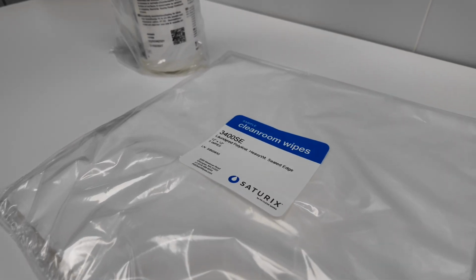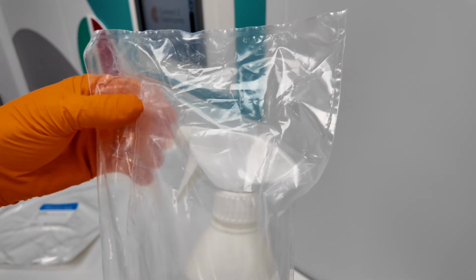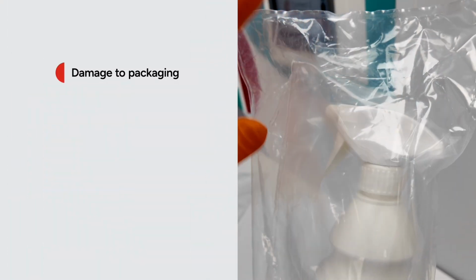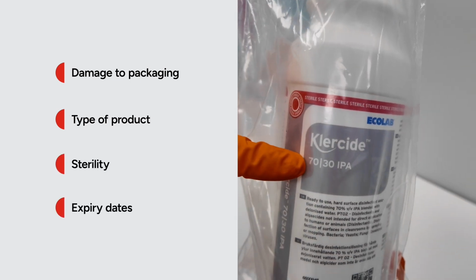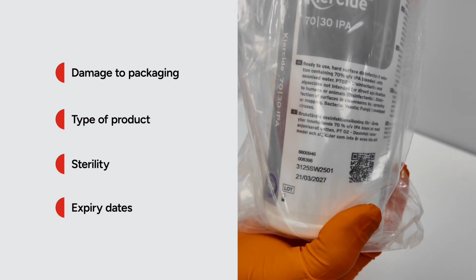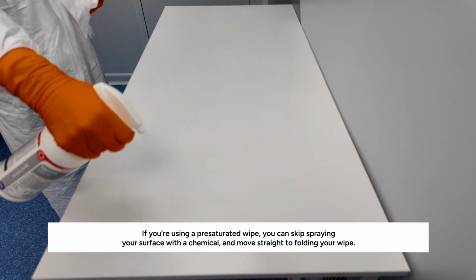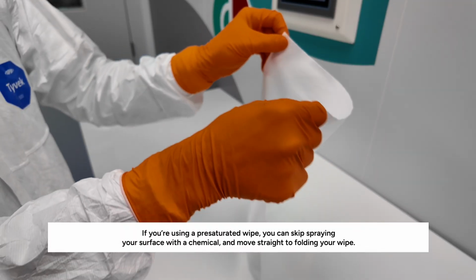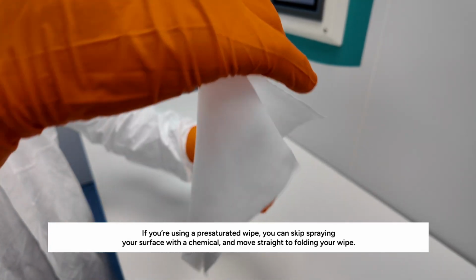When looking to correctly clean your cleanroom surfaces, firstly review the cleaning products to ensure they're fit for purpose. Key areas to check include ensuring the packaging is free from damage, the sterility of the product, the type of product, and the expiry dates. Once you've selected and checked your products, spray the surface evenly with the cleaning chemical. Then take your dry wipe and fold into quarters, half and half again.